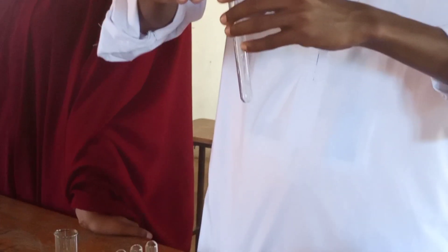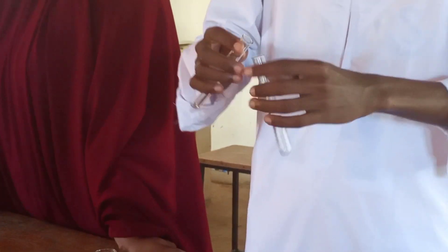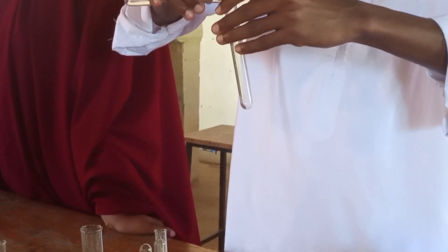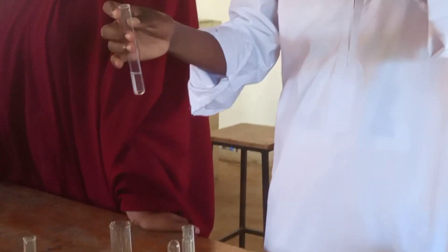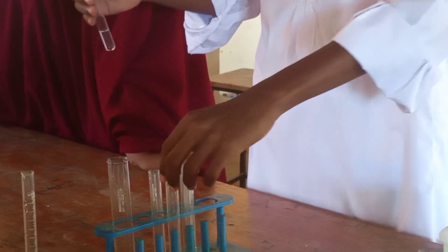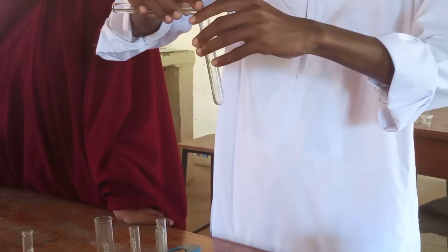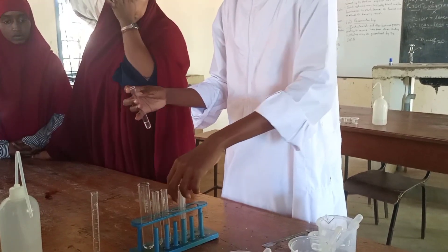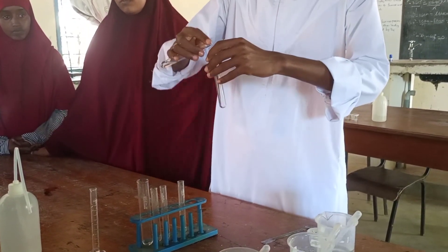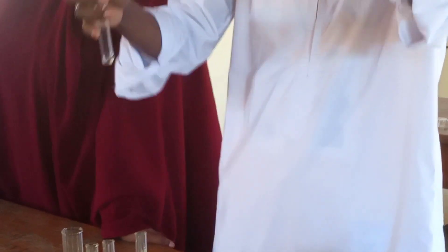After making the observation, divide the solution into four portions. Always take a small portion. That is the first portion, then the second portion, then the third portion, and finally the fourth portion.